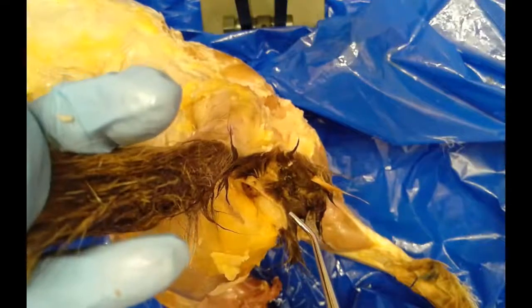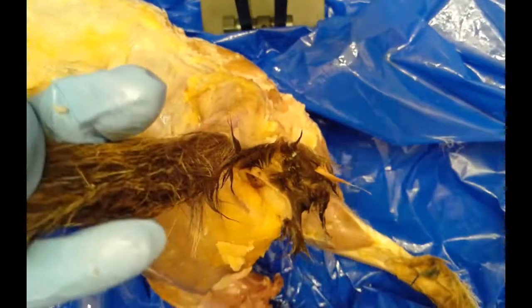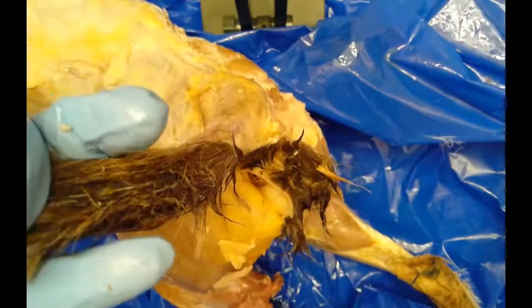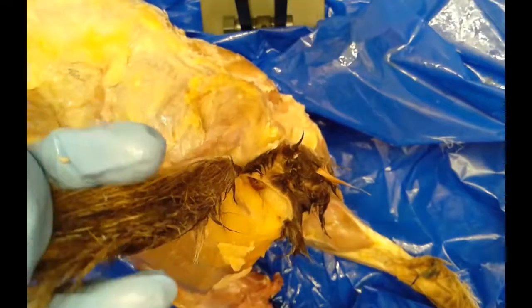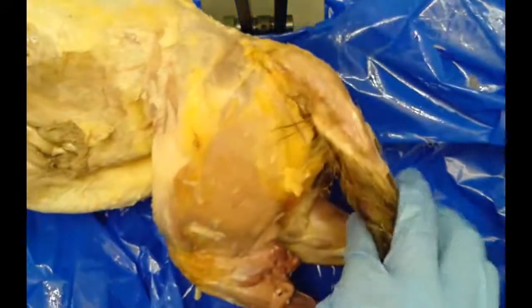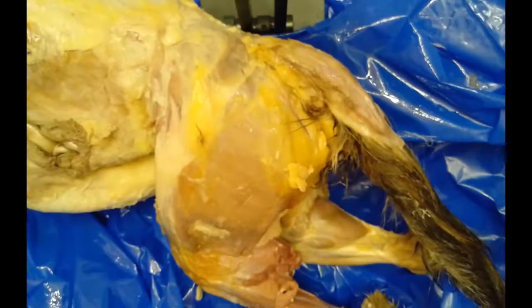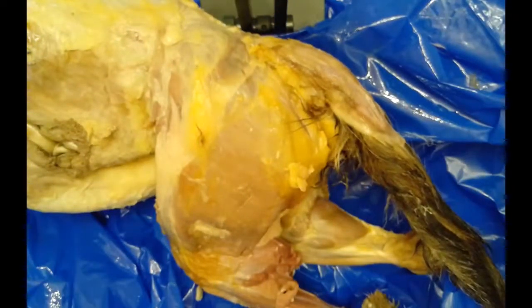That's our overview of the external anatomy. We now want to focus in on the muscles of the cat, so we're going to pause for just a second to orient ourselves.